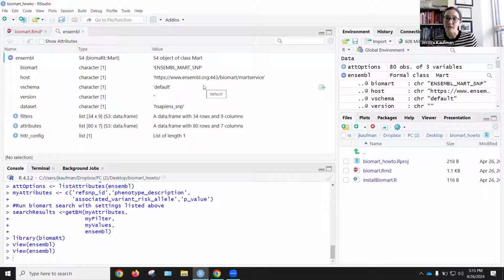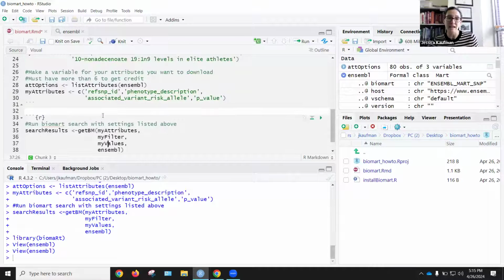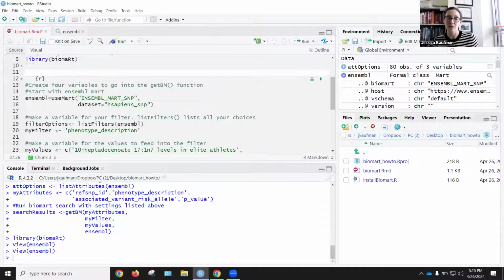We need to make sure for this project, which is about variation and about looking at single nucleotide polymorphisms, that we've selected Ensembl mart SNP and that we've selected the data set within there for Homo sapiens, so hsapiens SNP. Once you have wrapped your head around the 4 variables you want to create, you can go back and make a little code chunk that makes each of those variables. So the mart we want to select, useMart, ensembl mart SNP, dataset Homo sapiens SNP.